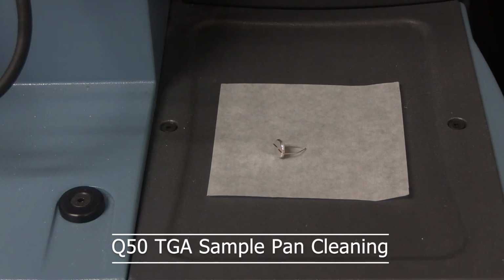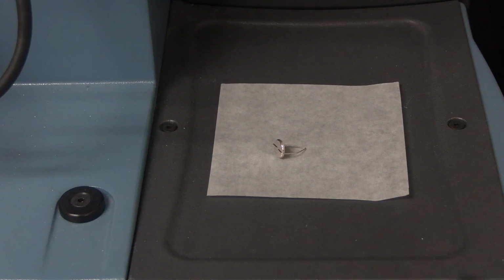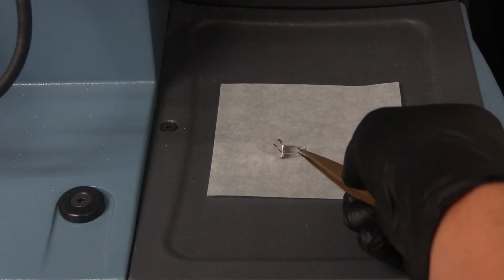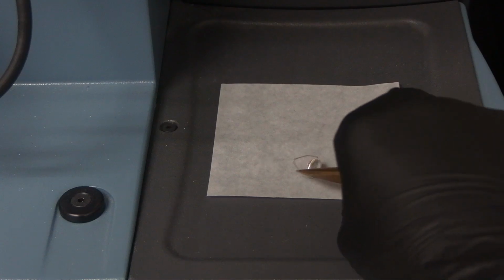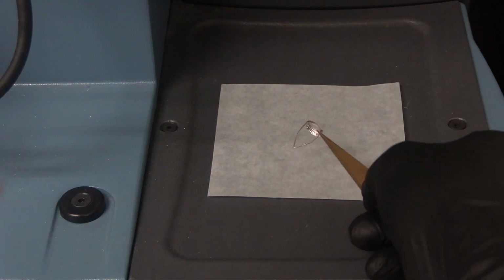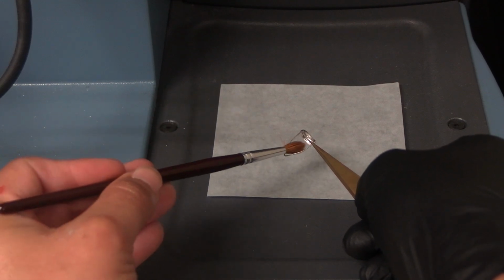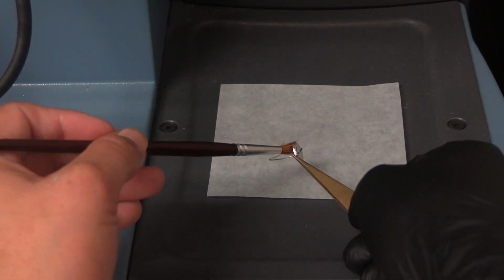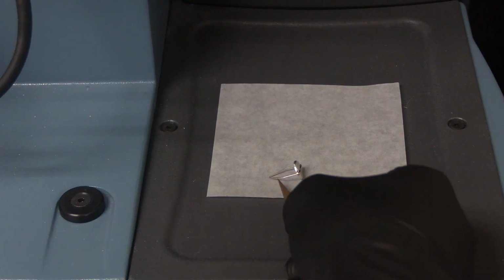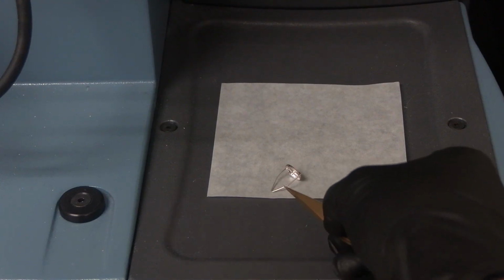Q50 TGA Sample Pan Cleaning. Wait for the sample pan to cool down before cleaning. Clean the TGA sample pan with a brush and torch. Note: only use the bronze tweezers to handle sample pans. Use a brush to gently brush any material out of the pan. The torch is located in the fume hood cabinet next to the instrument.